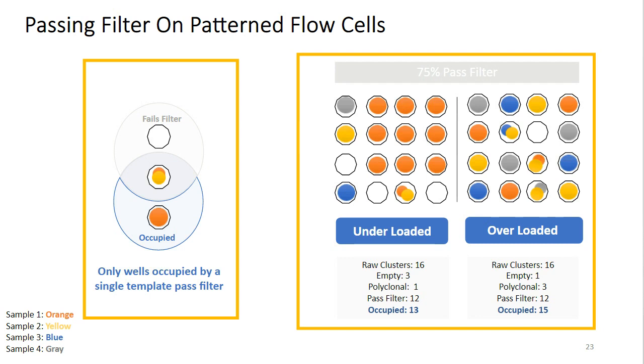So how do we distinguish between these two conditions? To help distinguish between the underloading and overloading conditions, we'll need to also look at the percent occupancy metric. The percent occupancy metric is the percent of wells that have one or more templates clustered in them and are therefore showing some sort of signal.